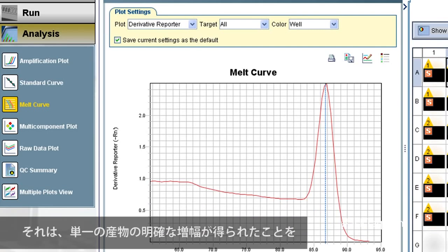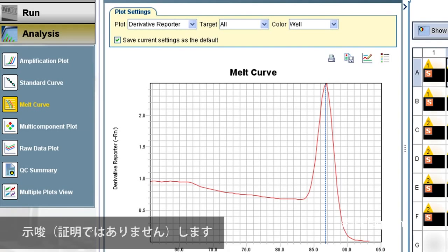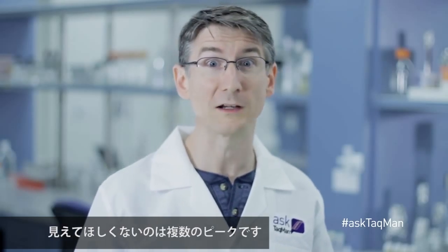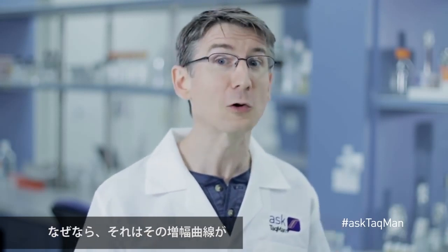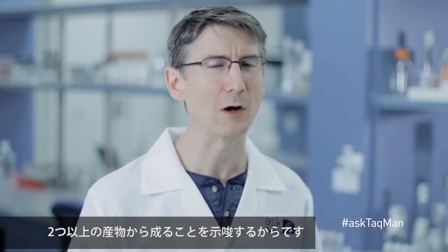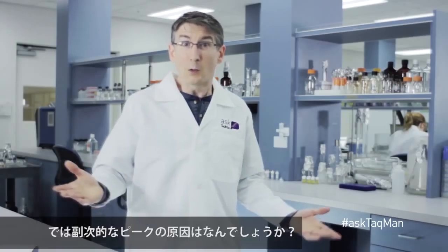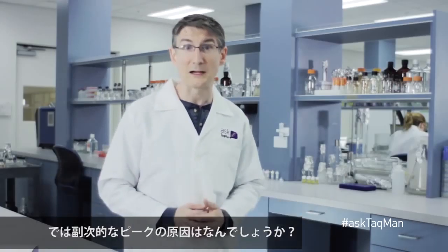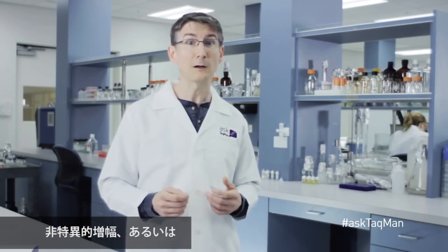What we're hoping to see is one clearly defined peak, which suggests — doesn't prove, mind you, but suggests — that you have a clean amplification of a single product. One thing you most definitely don't want to see is multiple peaks, as this suggests your amplification curves are a composite of more than one product. That is not a good thing.